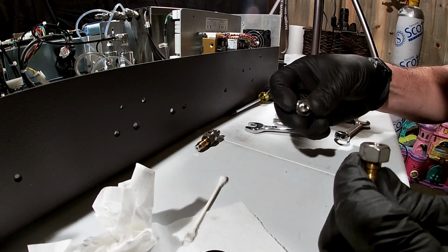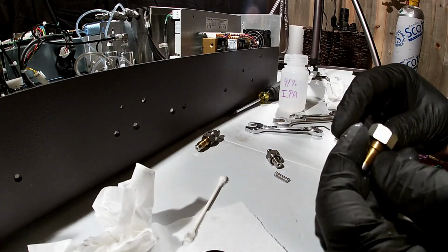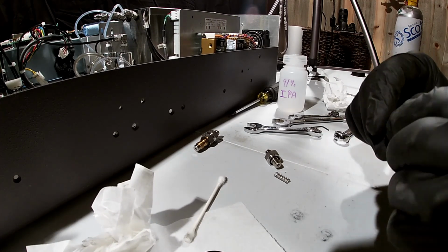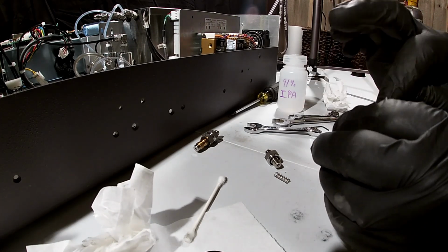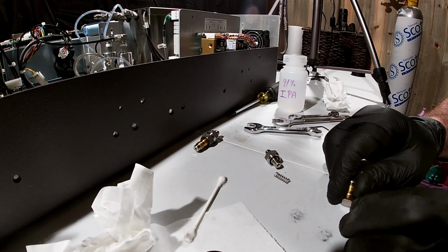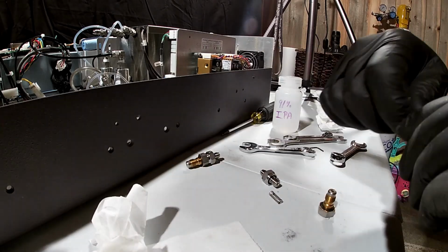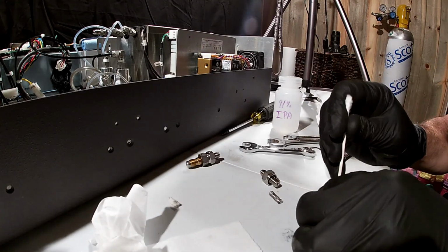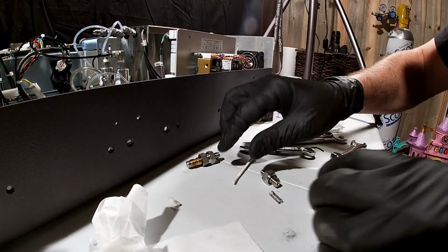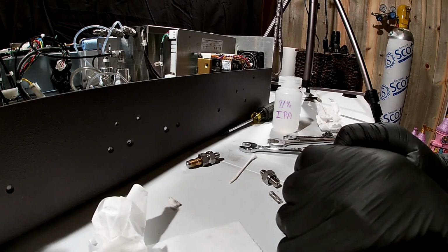So we're going to see the top piece. There's going to be a spring, and then you see a lot of crud coming out of there. Sometimes these pieces are a little hard to get out, and you've got to be careful about poking down in here because you don't want to break that ruby orifice. Let's see if I can give it a good tap. Now we're going to have to push it out. I may be able to use this Q-tip without any cotton on it. Nope, that won't work either. I'm going to carefully try the Allen wrench here. It doesn't take much. There we go.